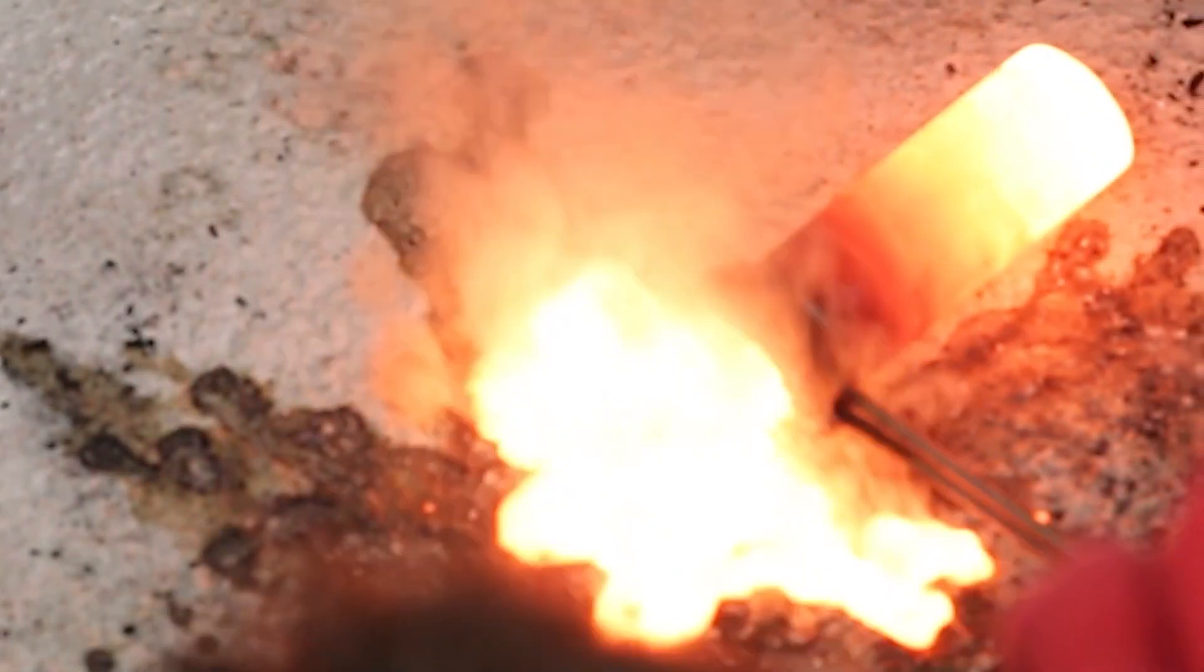So after a while, I just poured out all the contents on my concrete flooring because I don't have anything to put it on and then let it solidify.